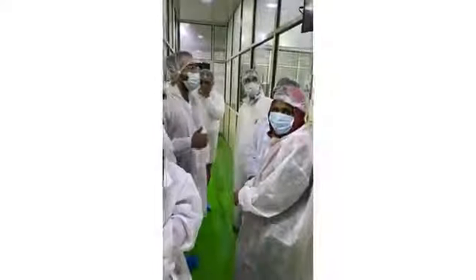Once it starts running, it will be displayed for all our operators also, to ensure all SOP has to be followed. It will be displayed here every time. What batch is running, what product is running. Standard operating procedures, all SOPs will be displayed here.